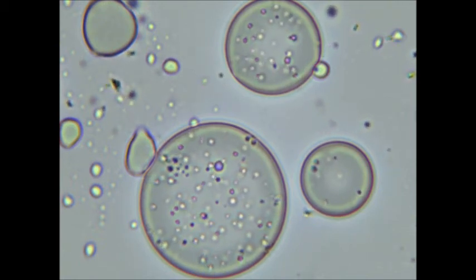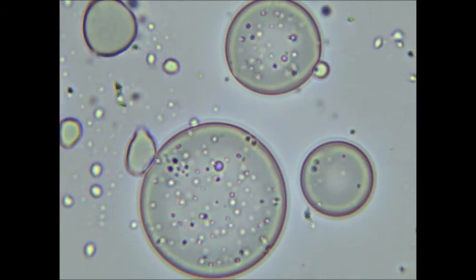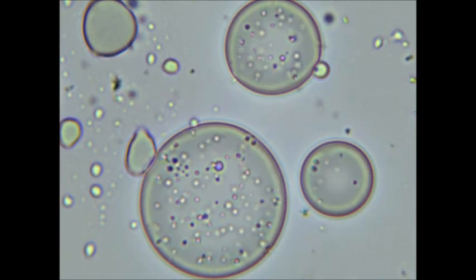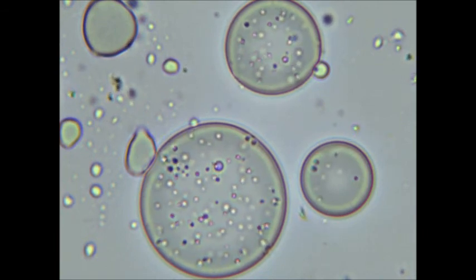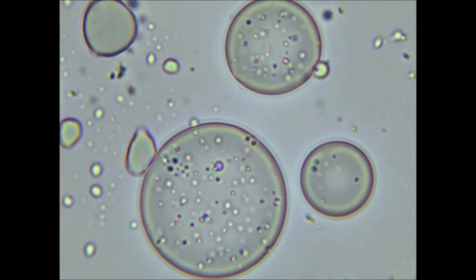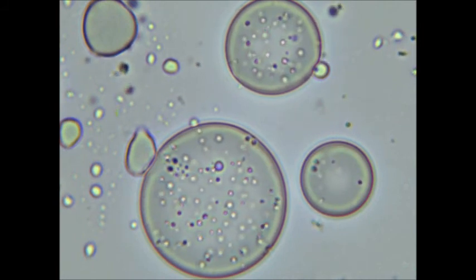I have done this experiment twice now, and this sample contains something that I really didn't expect to see. It appears that smaller fatty acid vesicles are inside the larger ones. I didn't see this with my first sample.